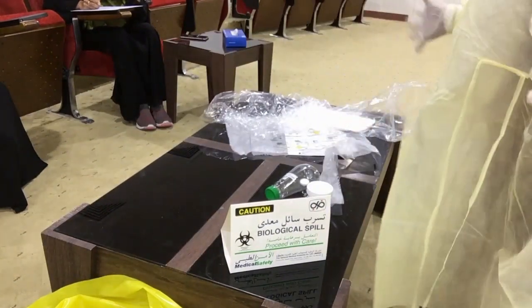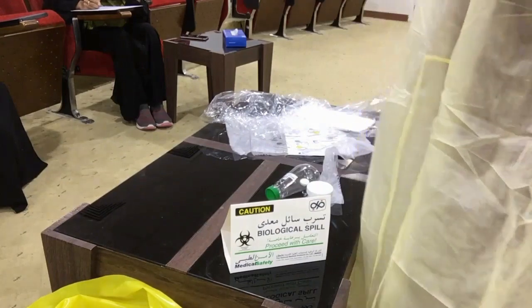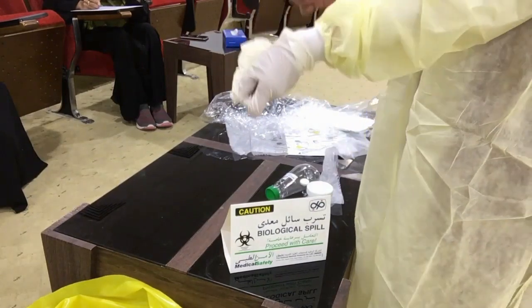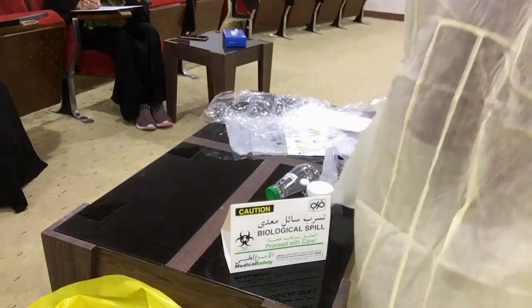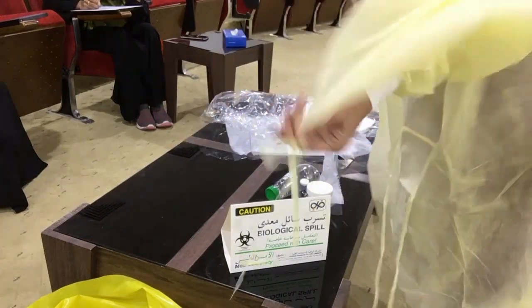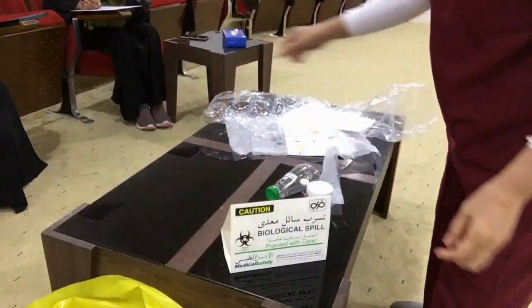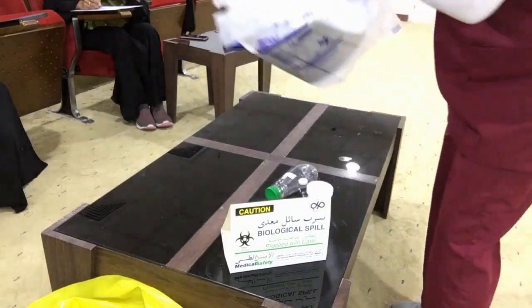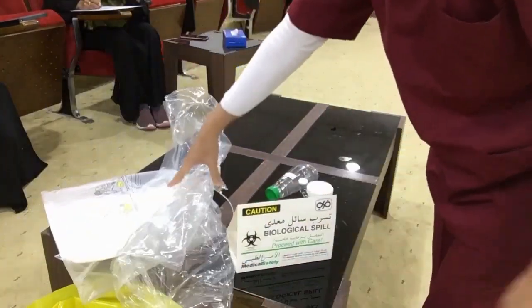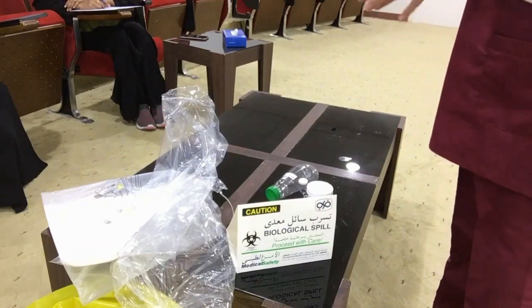After that, it's finished. You have to remove everything — remove the gloves, then the gown. Everything must be put in the yellow plastic bag. Then tie it up. Okay.